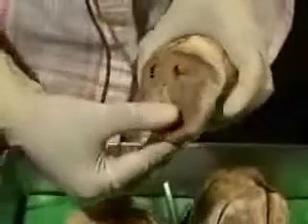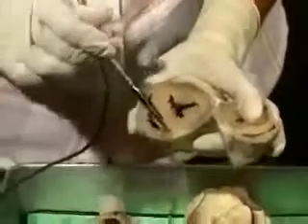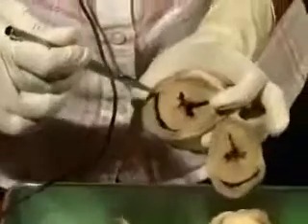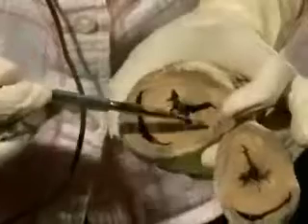Now the last specimen that I'd like you to see is a section which just cuts through the ventricular chambers, and this is just showing you the interventricular septum. Look at this. This is the interventricular septum. If you remember, I told you it curved towards the right ventricle. So you can see that the right ventricular cavity is sickle shaped, whereas the left ventricular cavity is kind of more rounded. Also look at how thick the walls of the left ventricle are compared to that of the right ventricle.